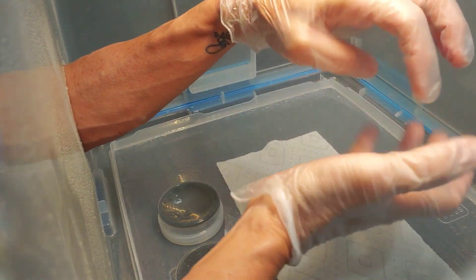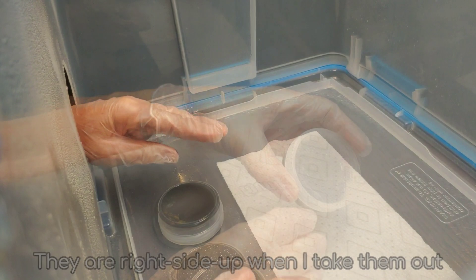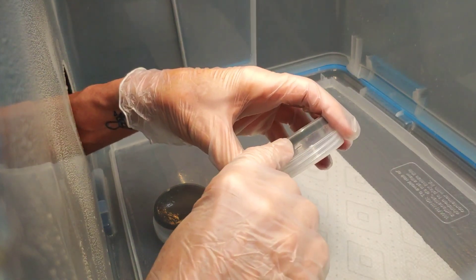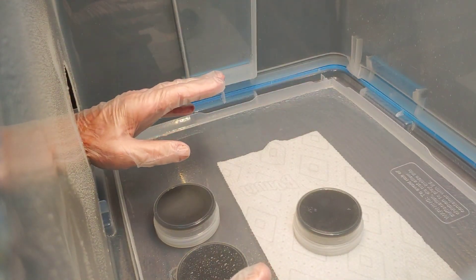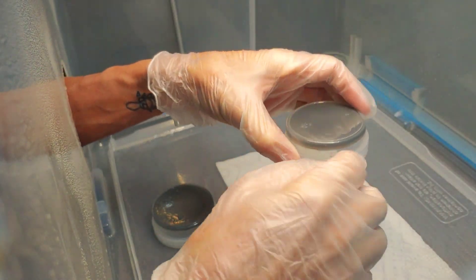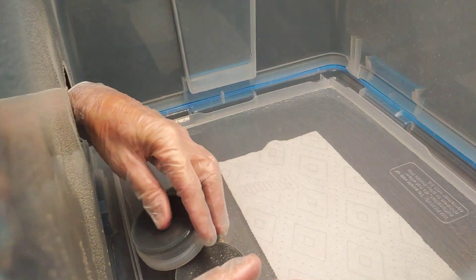Next day as I take them out, I leave them like that, tighten them, put them aside, take another one, tighten it completely, put it aside. After maybe 30 minutes when they're cooled down, I flip them over. If you flip them over right when you take them out, the condensation ends up on the agar, and we don't want that. So leave them right side up until they're hard, then flip them upside down — usually 20 to 30 minutes.